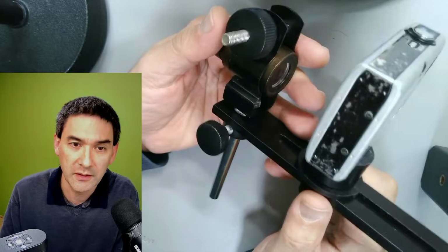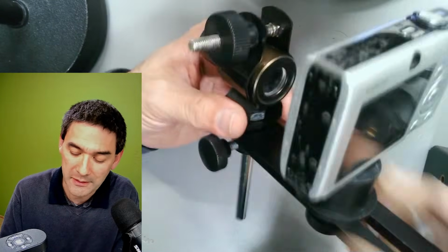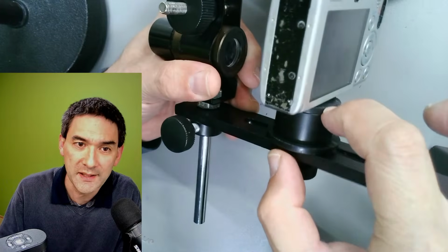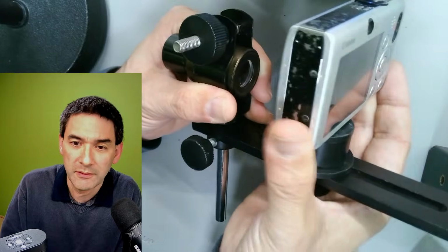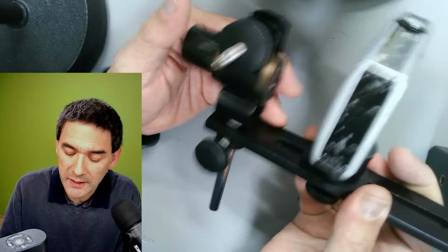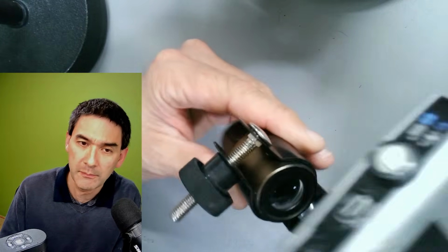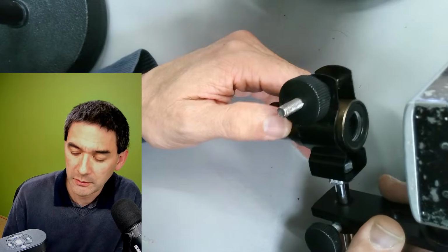So this is actually quite a nice one, but it's also large and clunky. The reason why it doesn't move at all is because of the rubber paddings. There's a rubber padding over here, and one over here, and it doesn't move even a fraction of a millimeter, if everything is set up properly. I put this, for example, on my photo tube like that, and it also works.